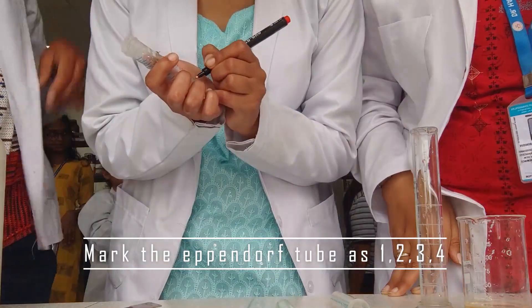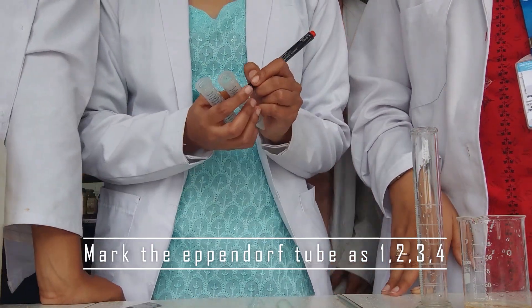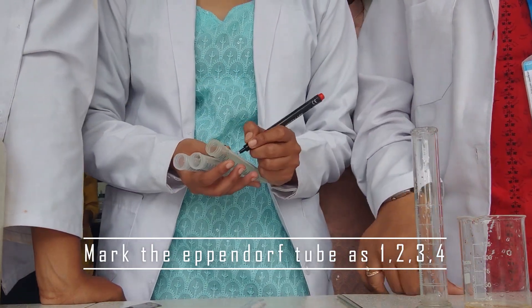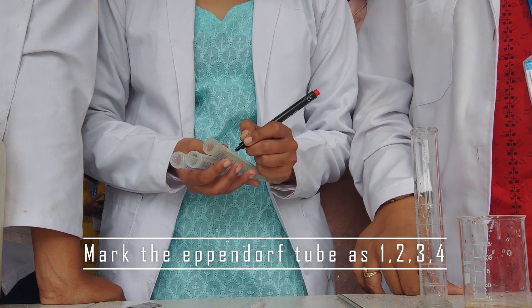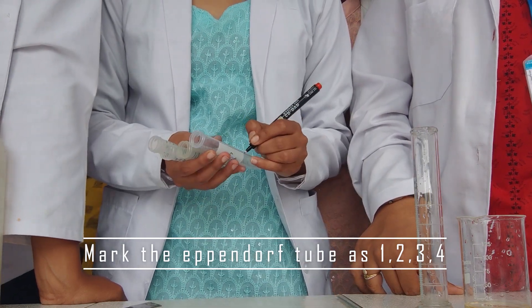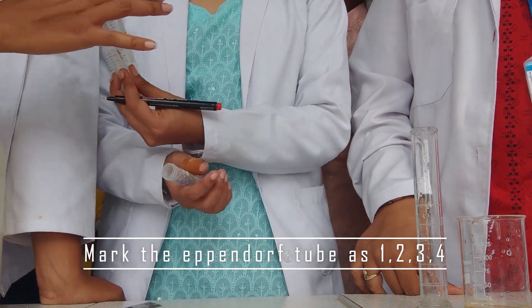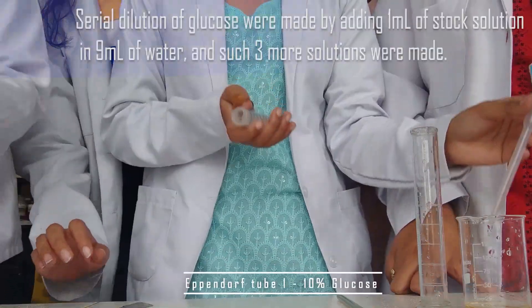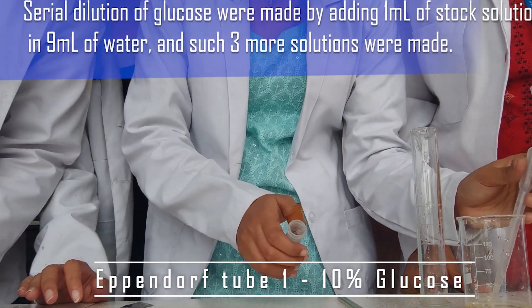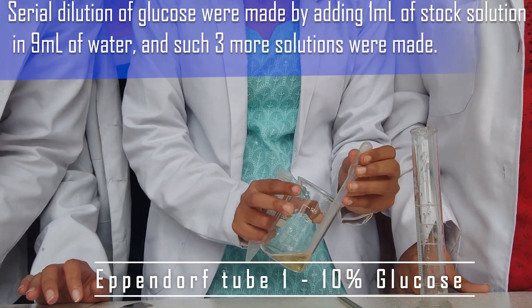Mark each Eppendorf tube as one, two, three, and four. Use a marker or any label to mark them. Now the next step is our serial dilution — this is a very simple step.